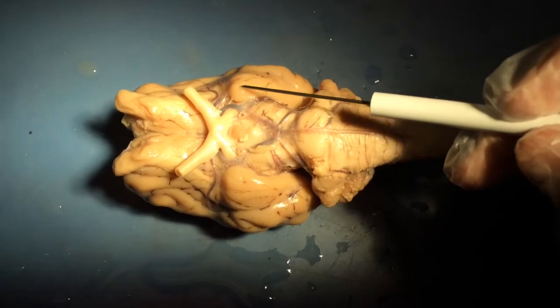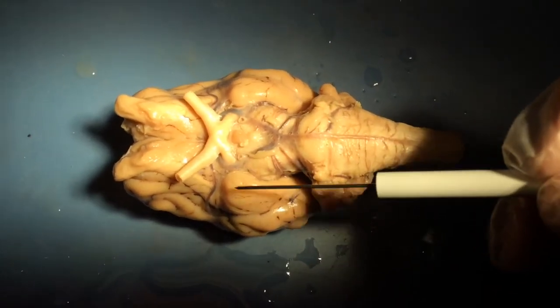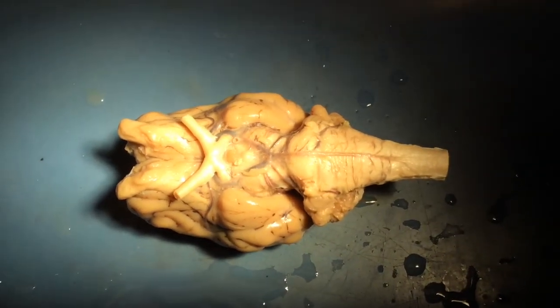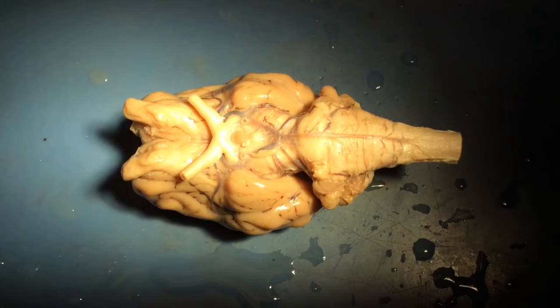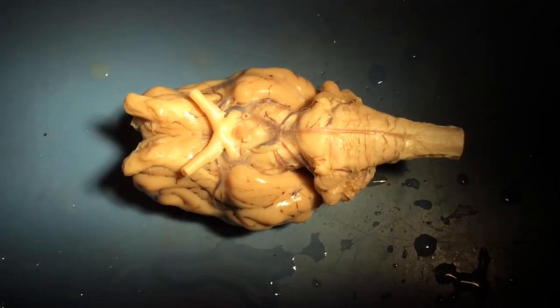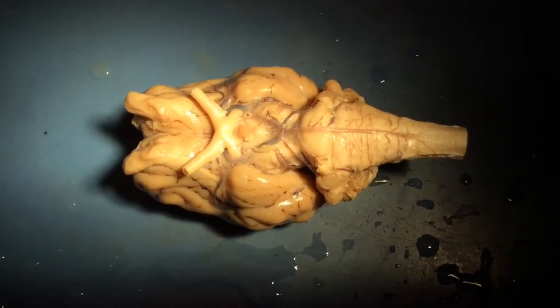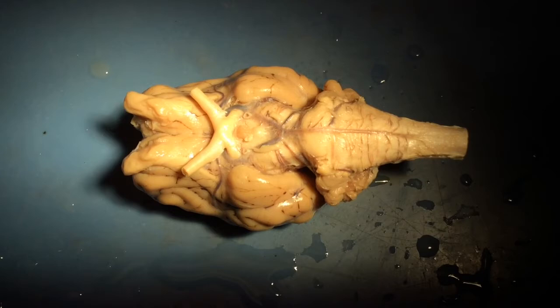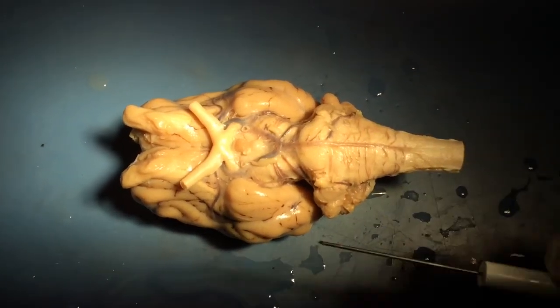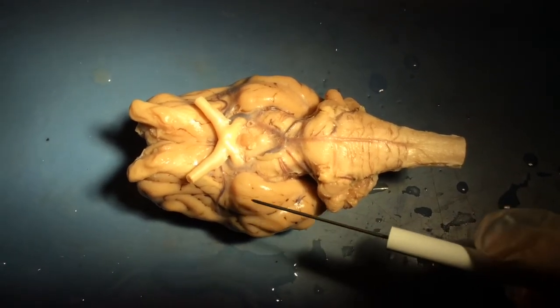Very lateral to the pituitary gland, you can see a little bit of cerebral cortex that is coming around to the underside of the brain. I mentioned in the previous video on dorsal structures that you could see three of the four lobes of the sheep brain from the top surface. This is the fourth lobe, which in humans would be called the temporal lobe. In sheep, it's often called the piriform lobe, and it's somewhat similar to the temporal lobe in humans, but much, much smaller.